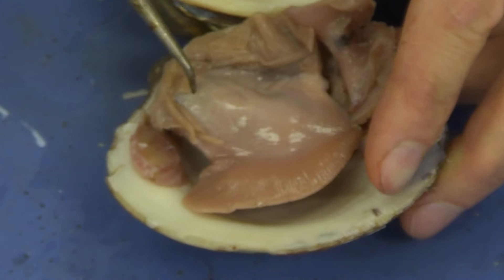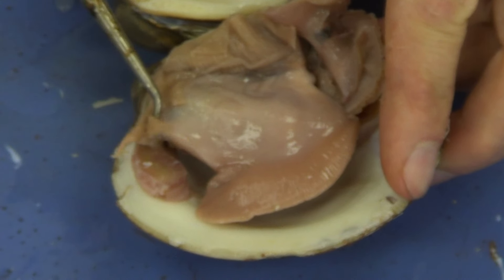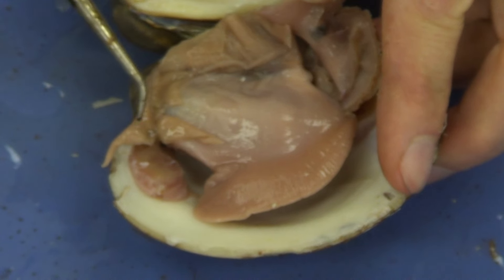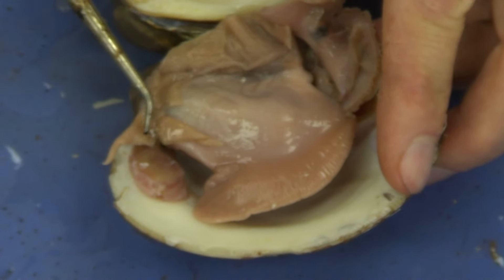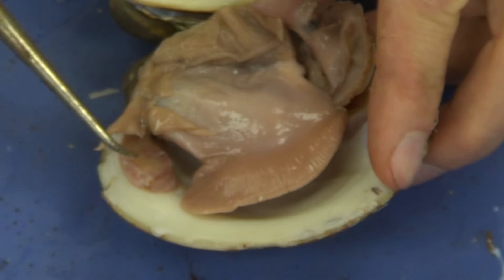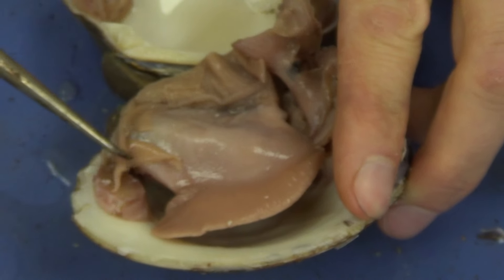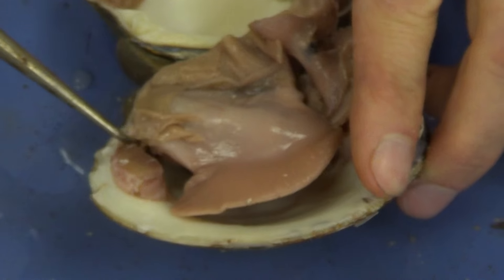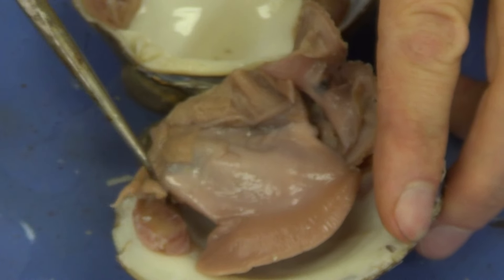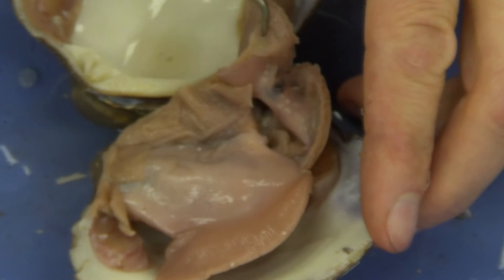We're going to open that up in just a minute. Now, if I look over to the anterior aspect — it's shorter here, the headward aspect — I see two long pieces of tissue. These are referred to as the labial palps. Labium means lips, so these are lip-like structures. These lip-like structures are used to guide food — small bacteria, pieces of plankton — into the mouth of this organism. At the base of these labial palps we can sometimes see a small opening — that is the mouth. Sometimes we're able to see it and sometimes we're not. The anus should be on the other side, and it is also somewhat difficult to find.